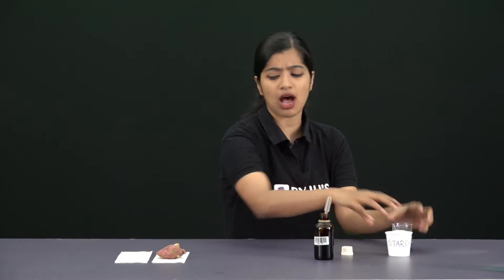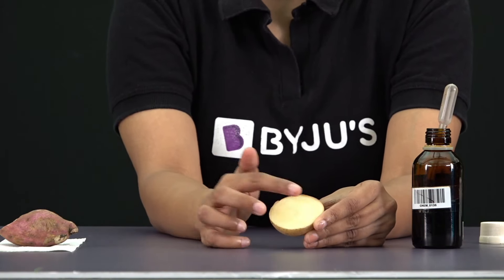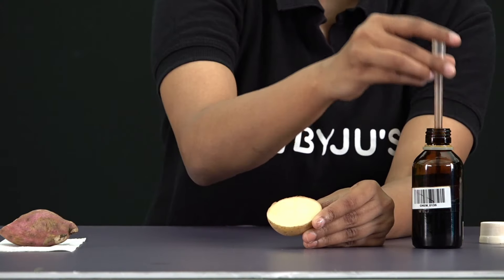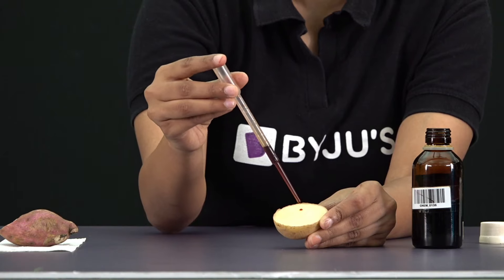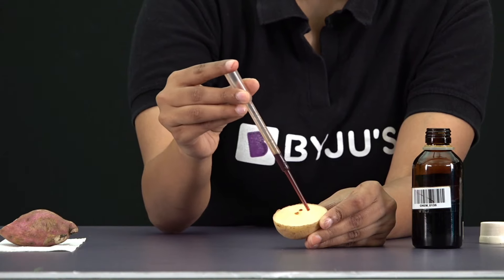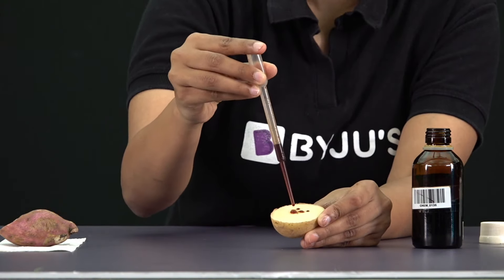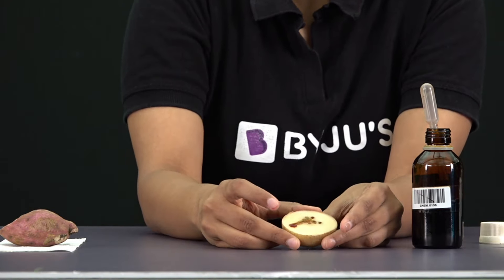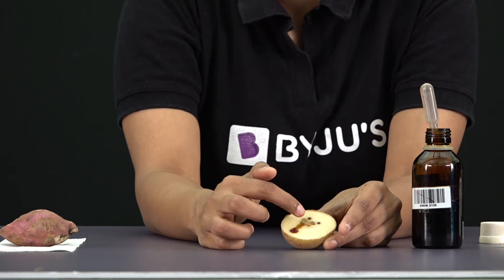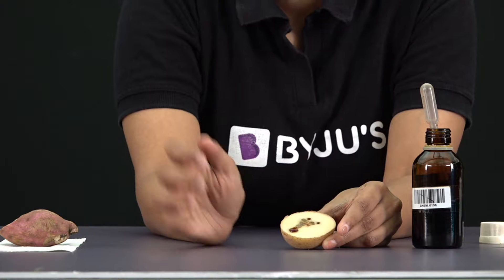Now let's try the same with our food samples. First up, let's take potato. If we look closely, we see that it has a yellowish beige color. Now I'm going to take my iodine solution and add a few drops, scattering it over the potato. Right now we see the brownish color, but if you look closely at the spots where I initially added it, we can see it is slowly turning blue-black.